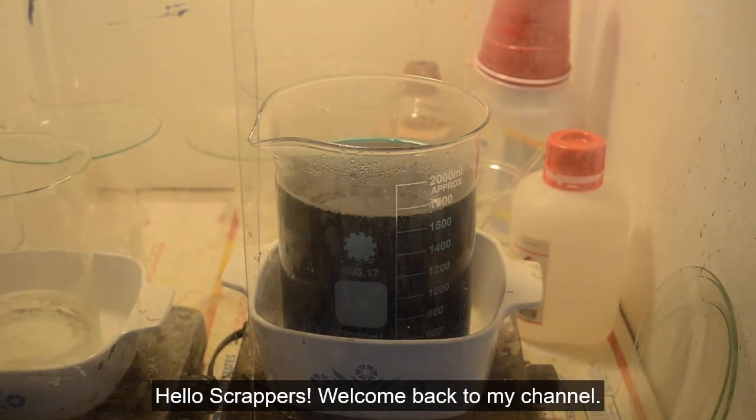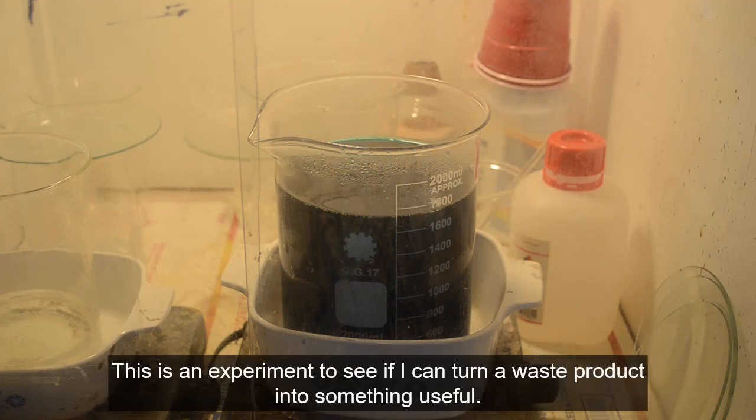Okay, so I'm doing an experiment here, and this may turn out to just be no good, but we'll see. Maybe fodder for the blooper reel.